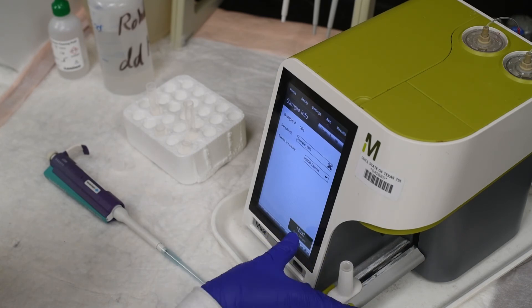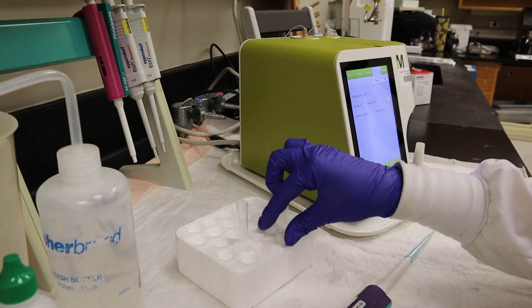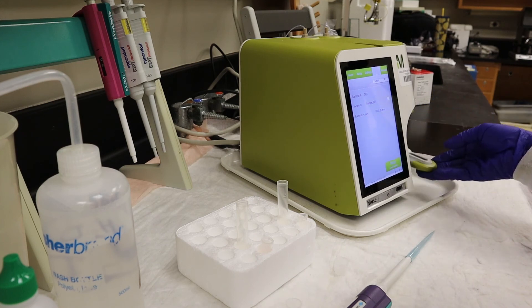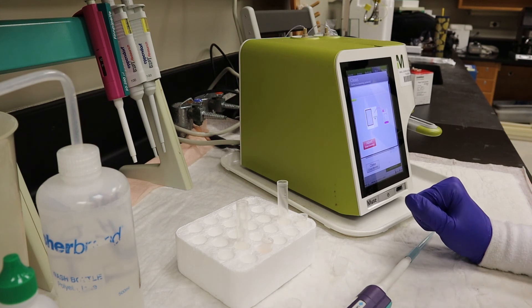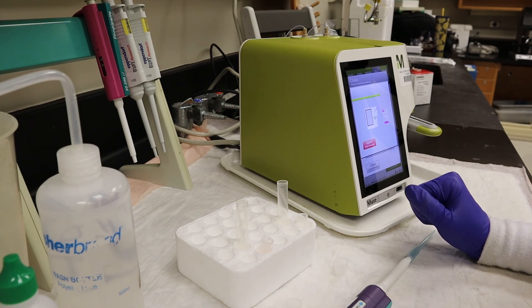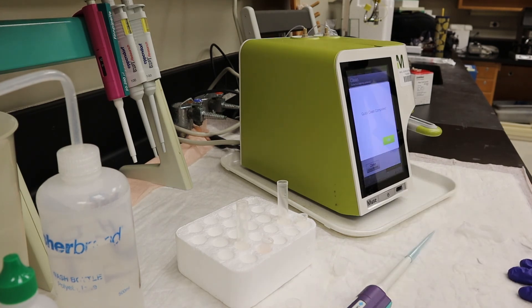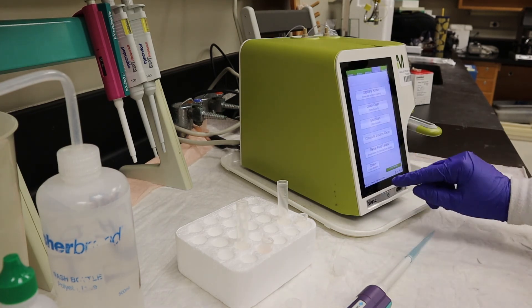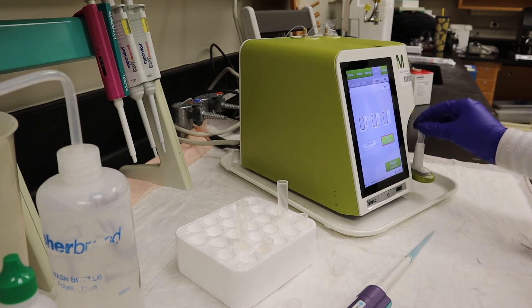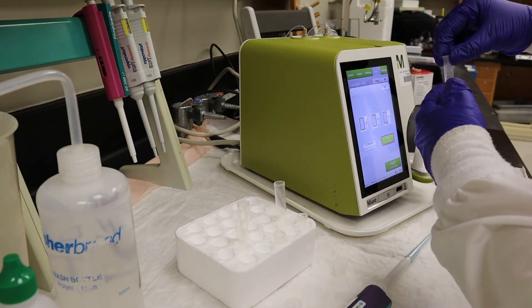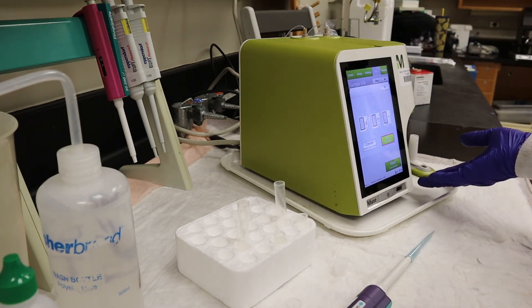Before running the analysis, I completed a quick clean to ensure that the capillary was free from any debris. Before running my sample, I lightly finger vortexed it to ensure there were no clumps.